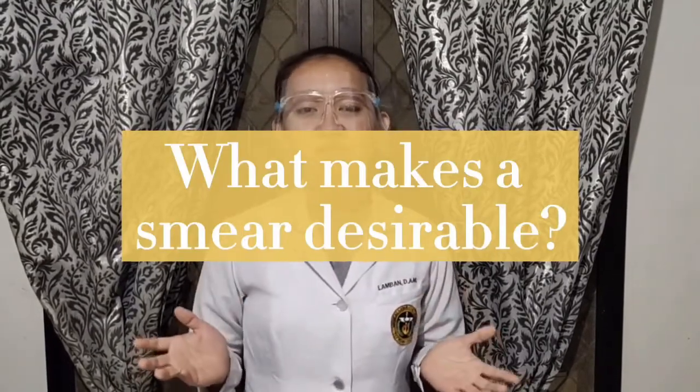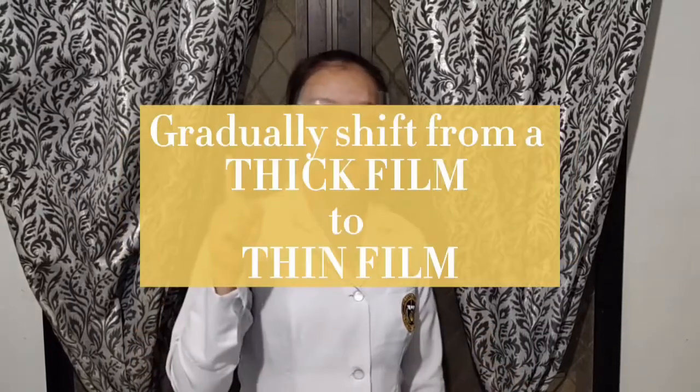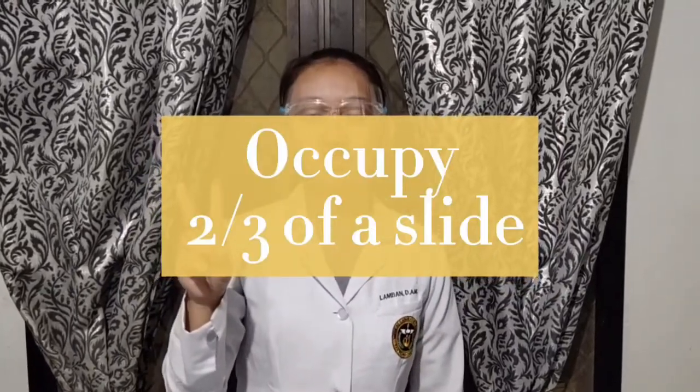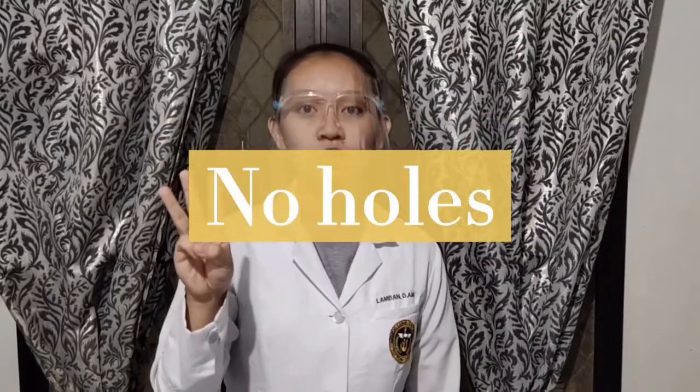Hi, I'm Danielle Lamban, and I will be demonstrating to you the different methods of smear preparation. But before that, I will show you the correct way of doing the smear. So, what makes a smear desirable? Number 1, it should gradually shift from thick film to thin film. Number 2, it should occupy 2/3 of the glass slide. Number 3, it should have no holes.